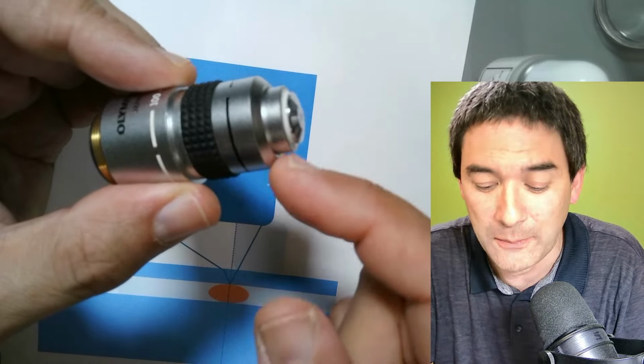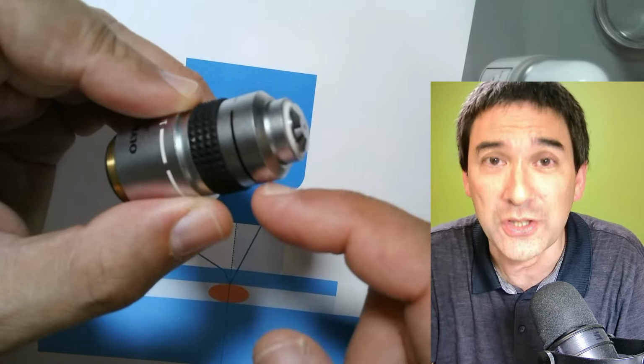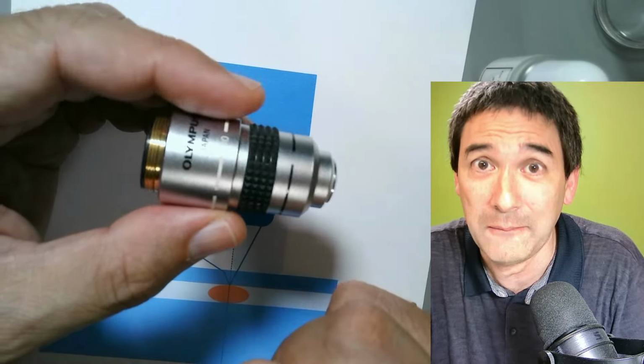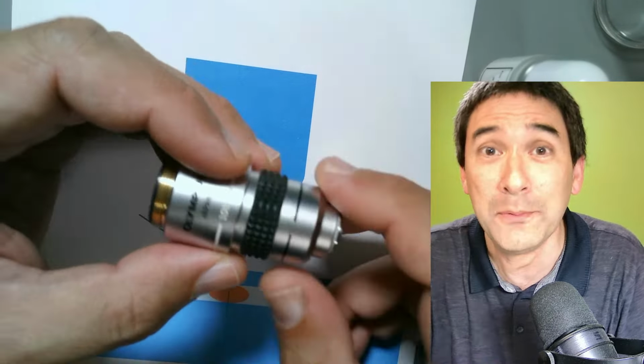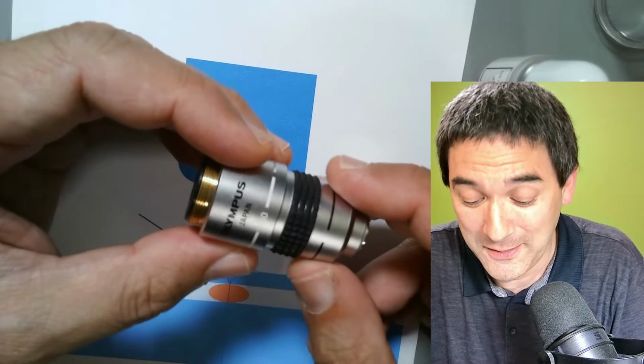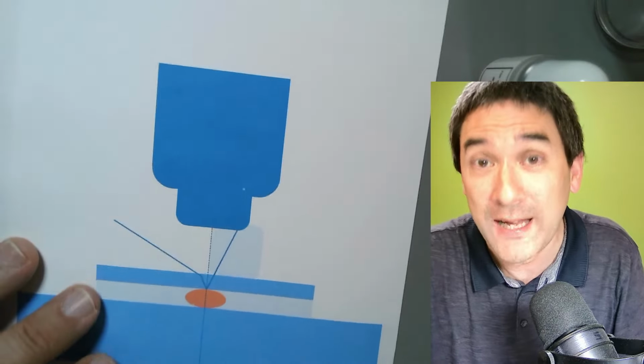It was so messed up that the oil actually went into the actual system. So they had to disassemble the whole objective and get it cleaned. He said this doesn't only happen to students, it can also happen to quite experienced people. So that's why I'm not a big fan of oil immersion, because one has to be careful.